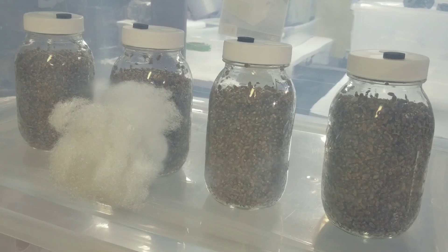The main thing I wanted to show you guys is the difference between going into the PC and out of the PC - that's the biggest contrast you're going to see when doing grain spawn. I was actually discussing this with one of my Patreon members, Kevin, who was just getting started doing grain spawn and saw a drastic contrast in his grain from when he put it in to when he took it out, so it was his idea for this video.